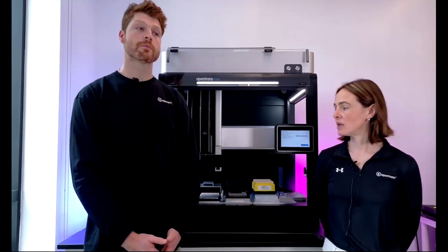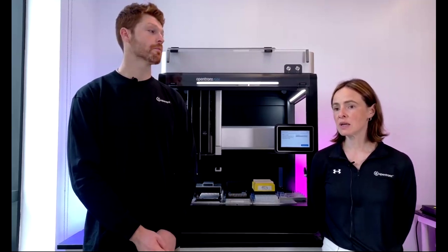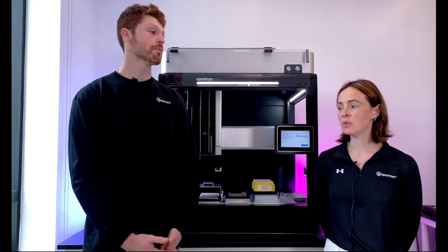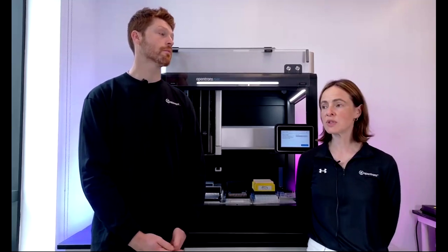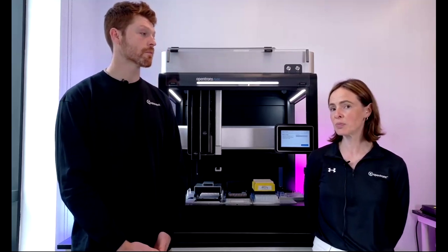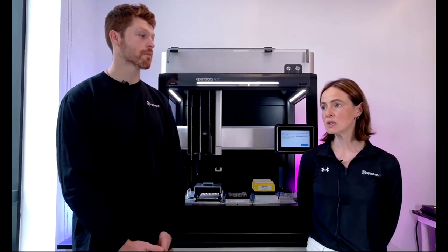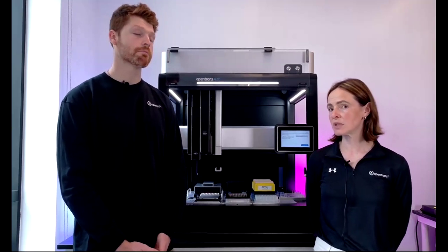Is there a limitation to what types of plates the gripper can move? Can it move unskirted plates? From Jacqueline. That's a great question. As Nick mentioned, it is limited to SBS format labware. We do recommend skirted or semi-skirted plates, particularly if you're going to be using the gripper in conjunction with the thermocycler, just because you have the gripper pressure that's changing things, and also the heat of the thermocycler. So we do recommend skirted or semi-skirted.